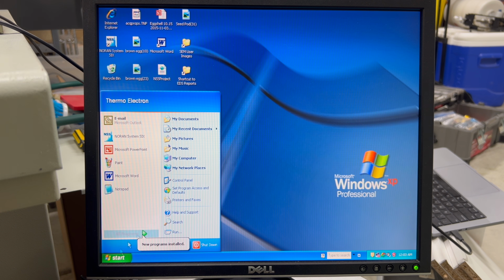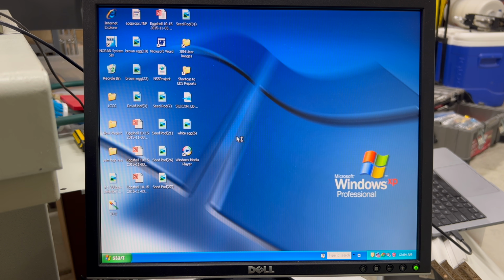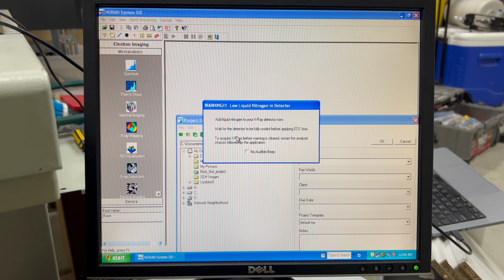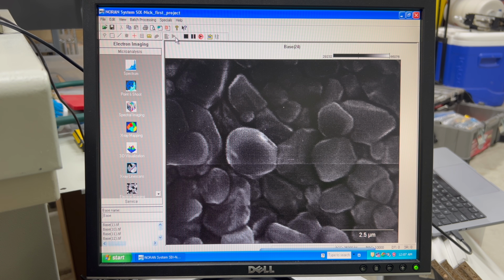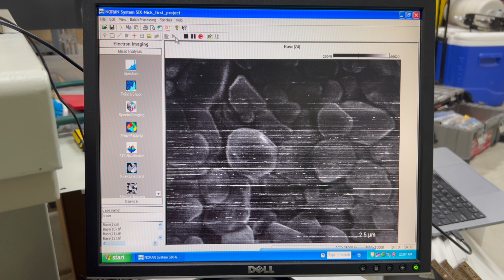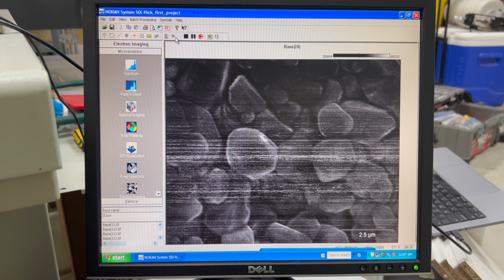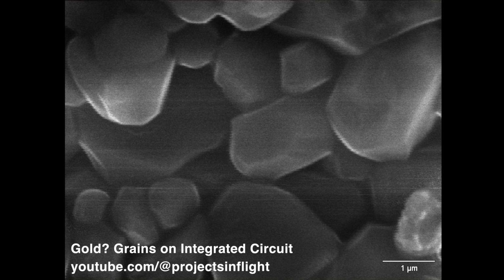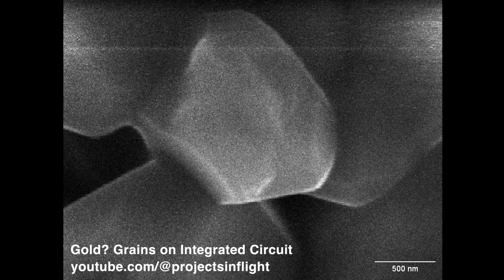I did actually manage to get it working. Well, sort of. It comes with software that allows you to capture images directly off of the microscope. Here are those grains from earlier. Now, this thing definitely needs some work. It's got some pretty serious signal integrity issues, but I did manage to capture a few good still images. Here are those small particles again. This is the highest resolution image I was able to get.